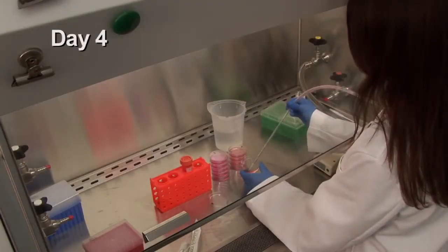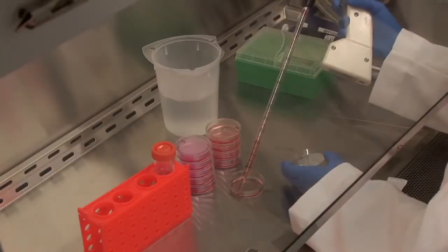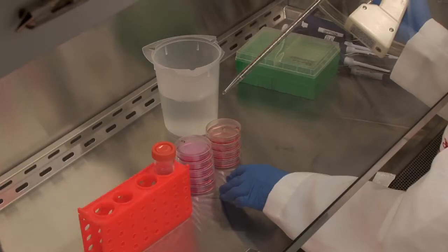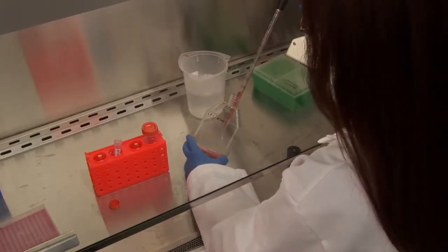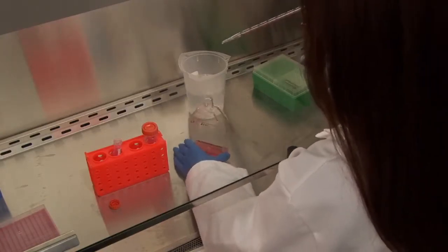On the fourth day, aspirate the media from the cells and add fresh media containing the therapeutic component at a predetermined optimal concentration. Then treat the cells with the component for a predetermined duration. In this study, cells are treated with 100 nanograms per milliliter of TRAIL and 1 micromolar of paclitaxel for 48 hours. Following treatment, surviving cells should be reseeded into T75 flasks and allowed to expand until nearly 100% confluent.